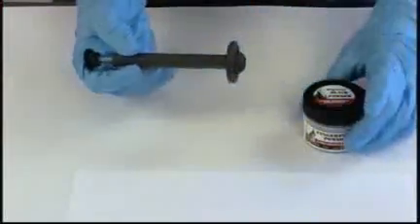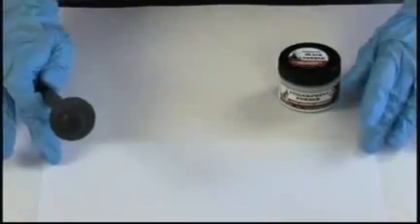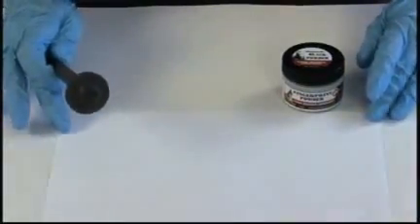We're going to start with it depressed so we can pick up our powder. On this blank sheet of white paper we have some fingerprints to develop.